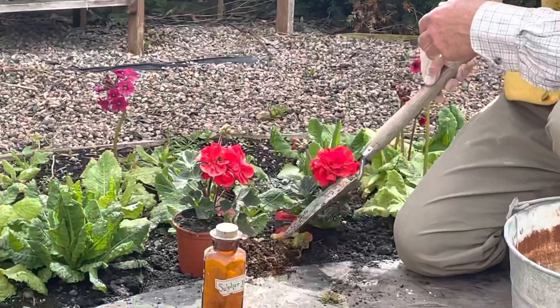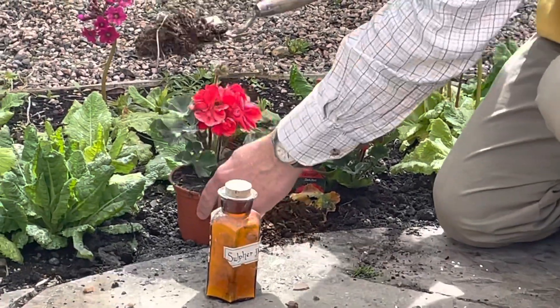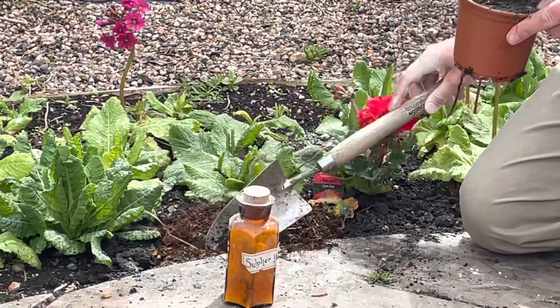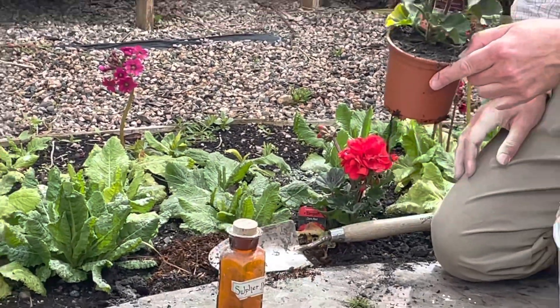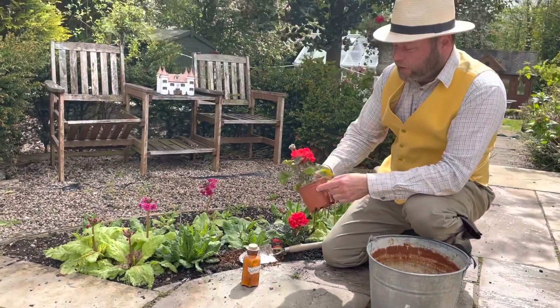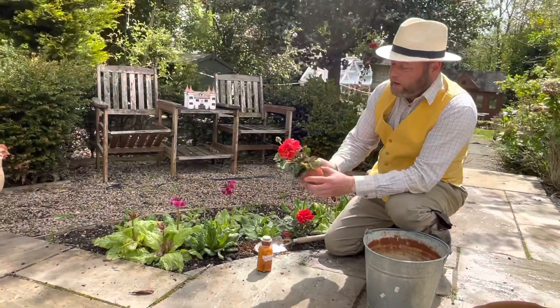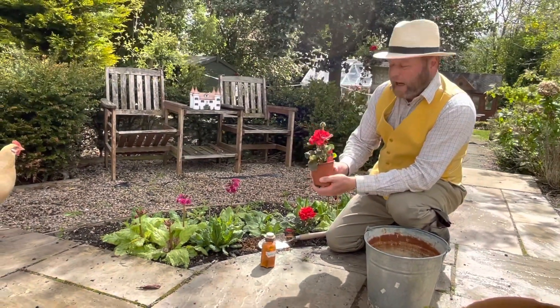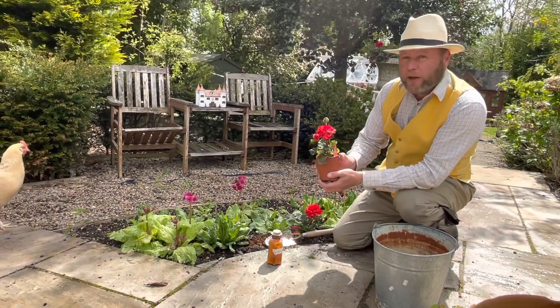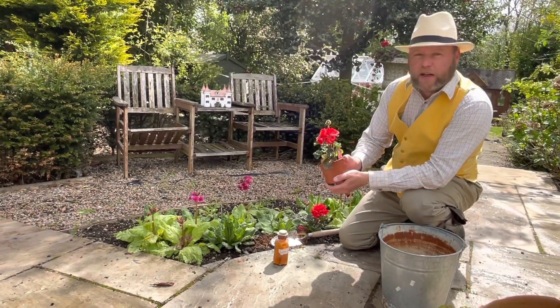One way of getting sulfur into plants is a good dosage of manure — horse manure. We'll look at the amount of hydrogen sulfide found in manures later on, and at the gas hydrogen sulfide as well. But first, we're going to see what happens to this lovely little geranium if it gets too much sulfur dioxide, looking at the destructive nature of acid rain and sulfur dioxide.